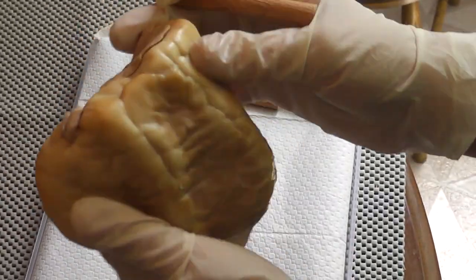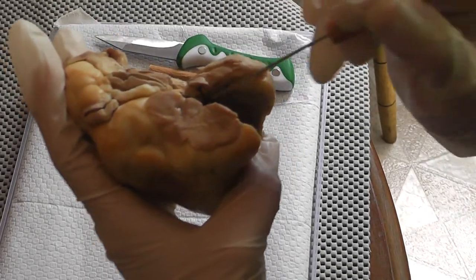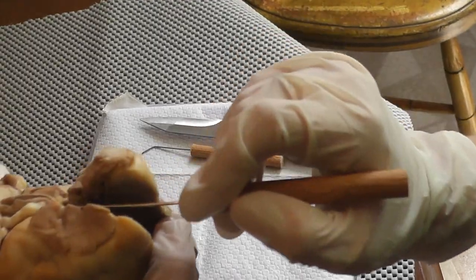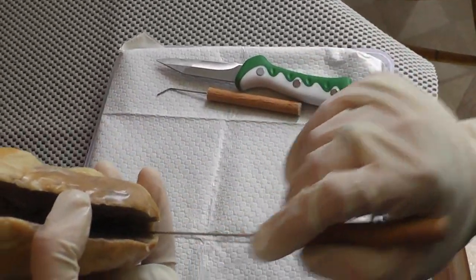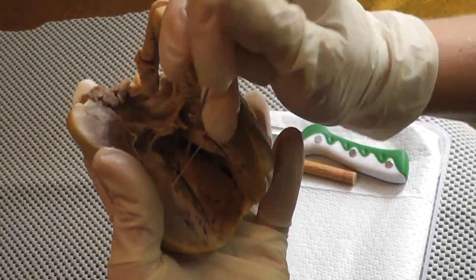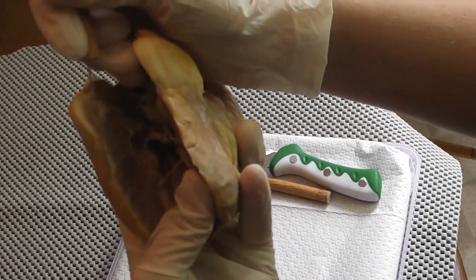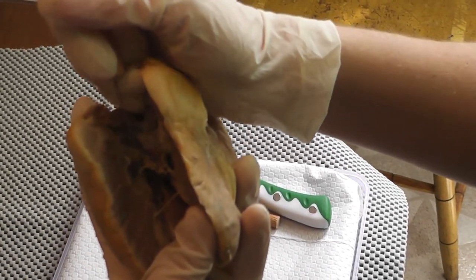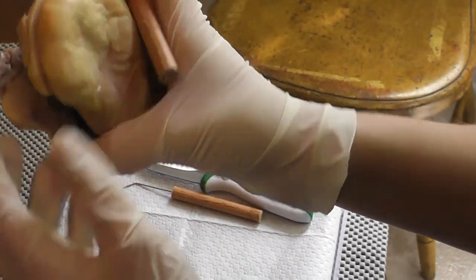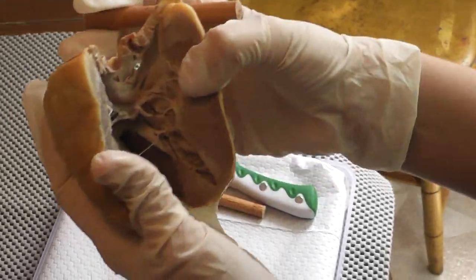Now we'll go to the left part of the heart, and what I did was I dissected through the left atrium and through the left ventricle. I did the longitudinal cut over here. Like I mentioned before, you can tell the difference between the right side and the left side because the left myocardium layer is so much thicker than the right one was. Here's the right one again, and the left one is a lot thicker. That's how you can tell that you're in the left side.